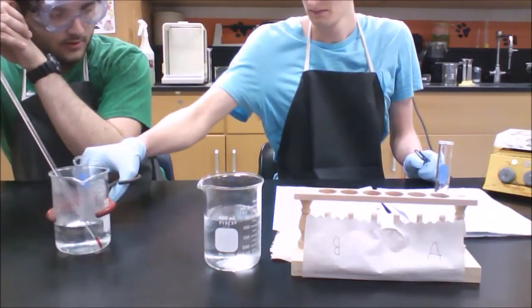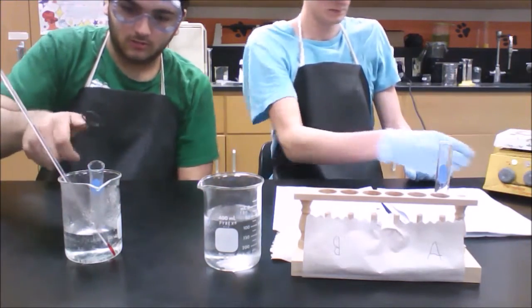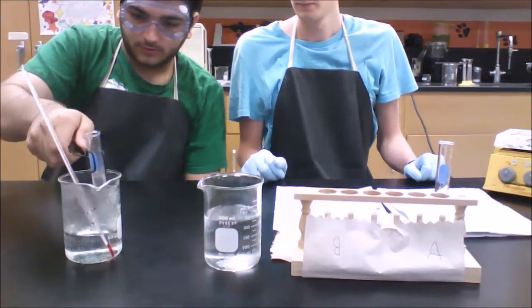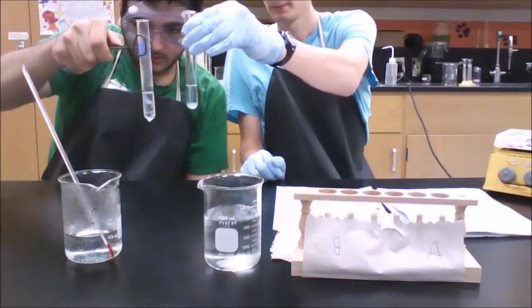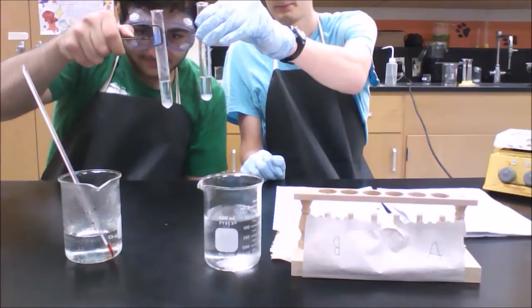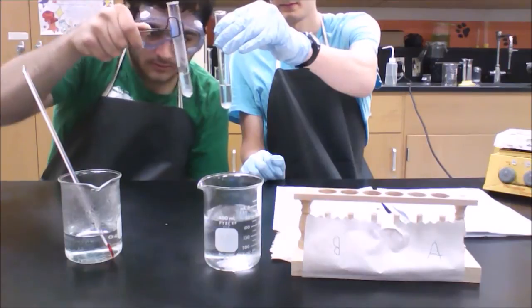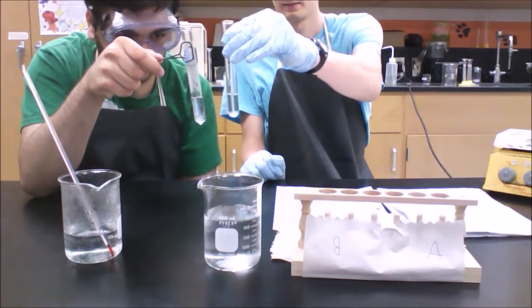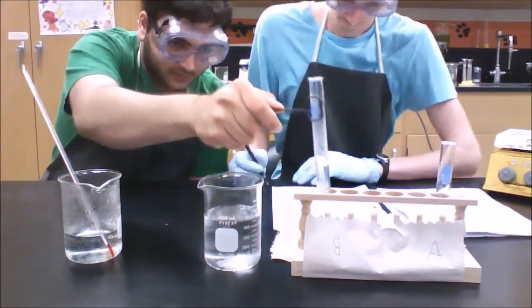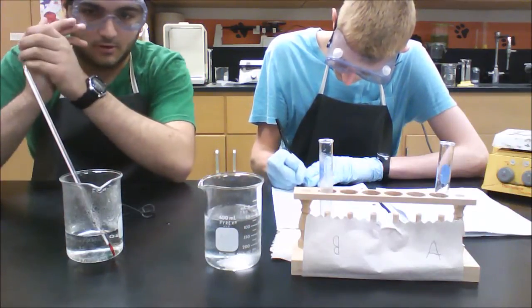So here is test tube B. Make sure to use tongs whenever you're picking up hot test tubes after being heated. You don't want to burn yourself. Let's compare it to test tube A. There is slight cloudiness collecting on the bottom of the test tube, as you can see, and bubbles have formed in test tube B. Everything else is still sort of clear except cloudy at the bottom. That is the end of part B of the introduction.